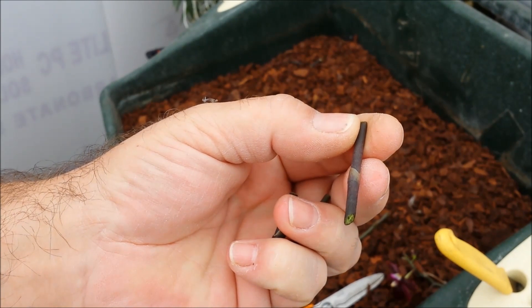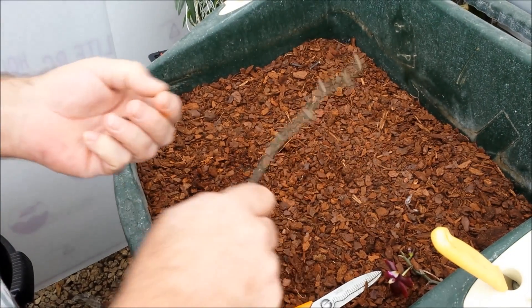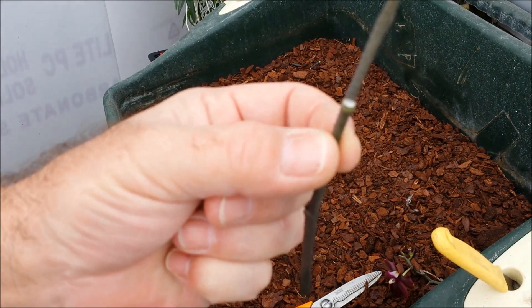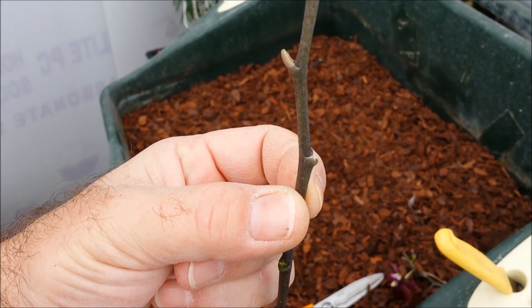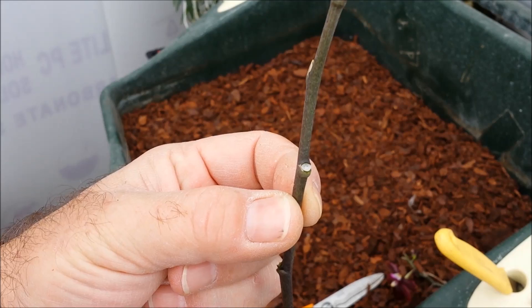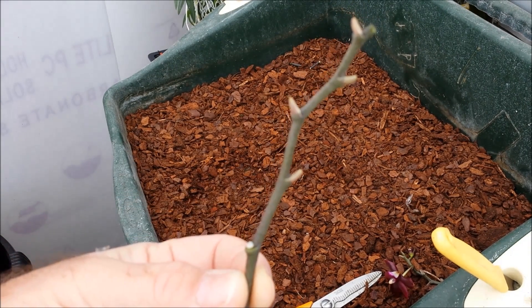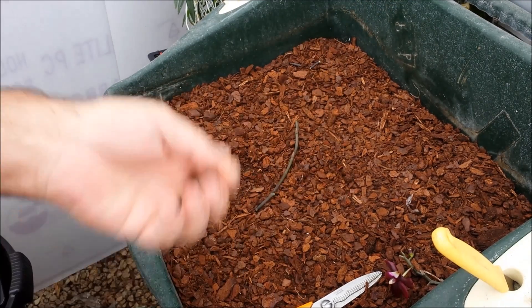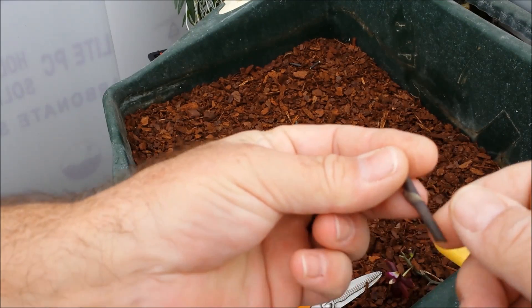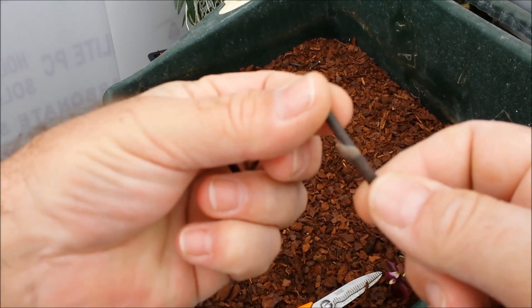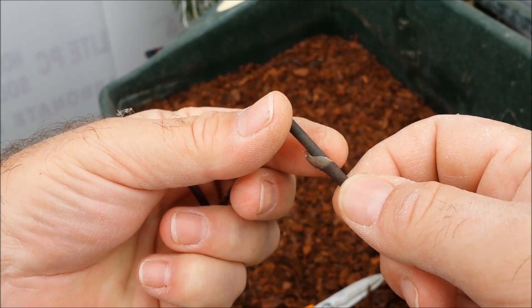midway is a bud. Now it's not a flower bud which would be like this one. This is an old stem which has previously flowered, and as you can see there's a white scar there where the flower was. Also, these have already flowered so they're no good. These are from further down the stem and they're from an area where it produced a bud but it hasn't yet produced either a flower or a stem.